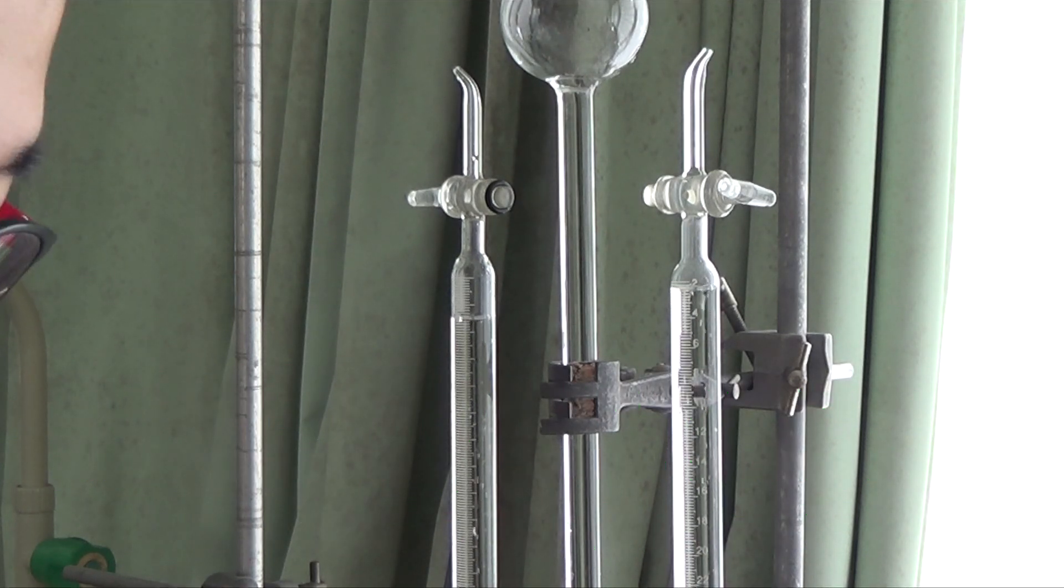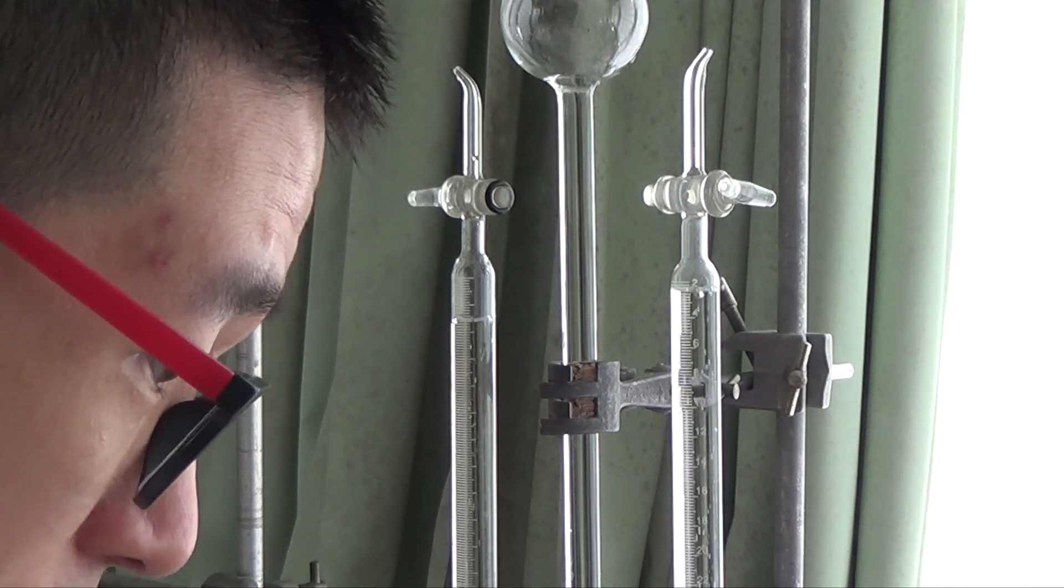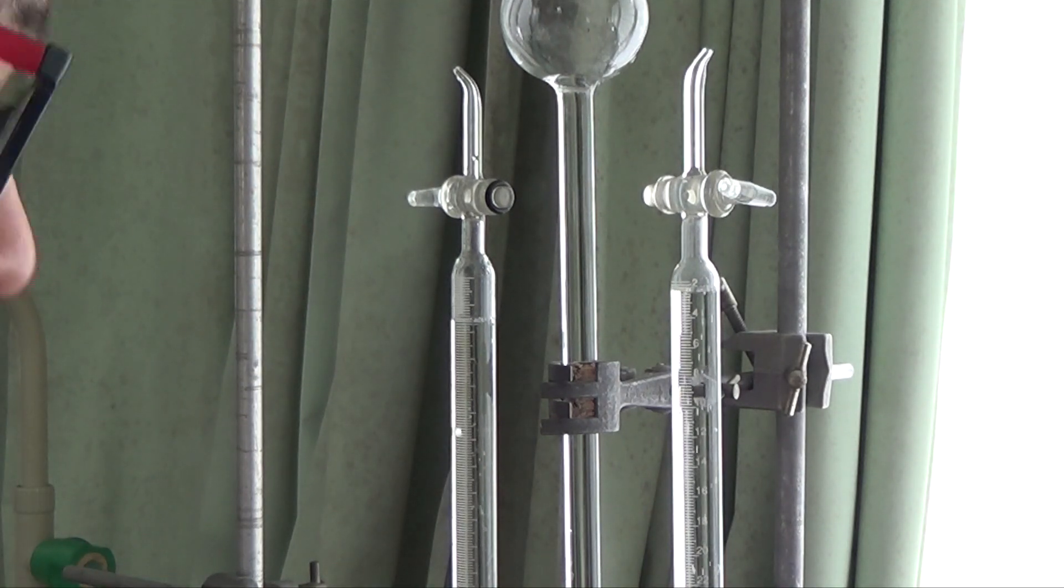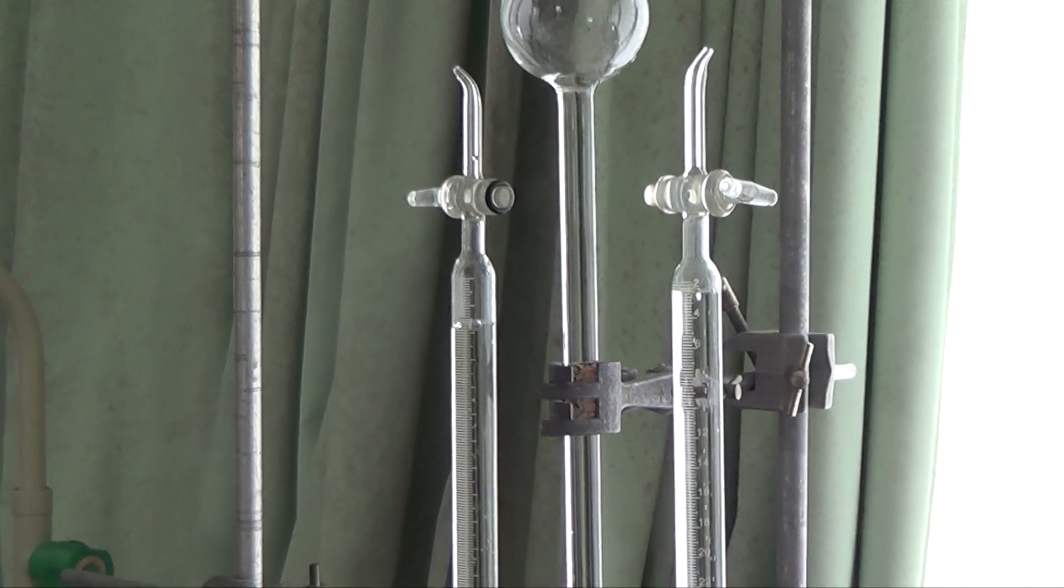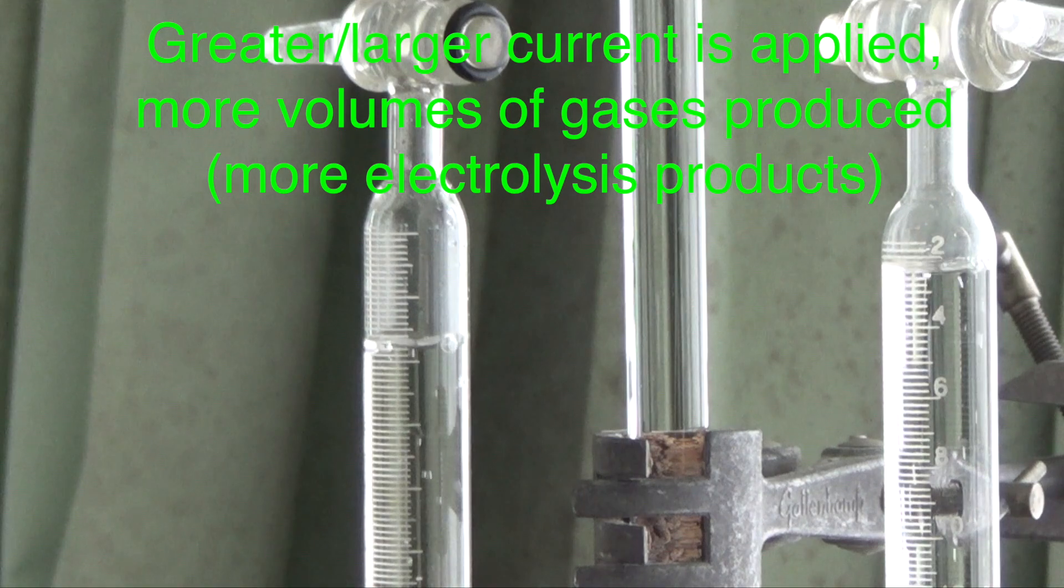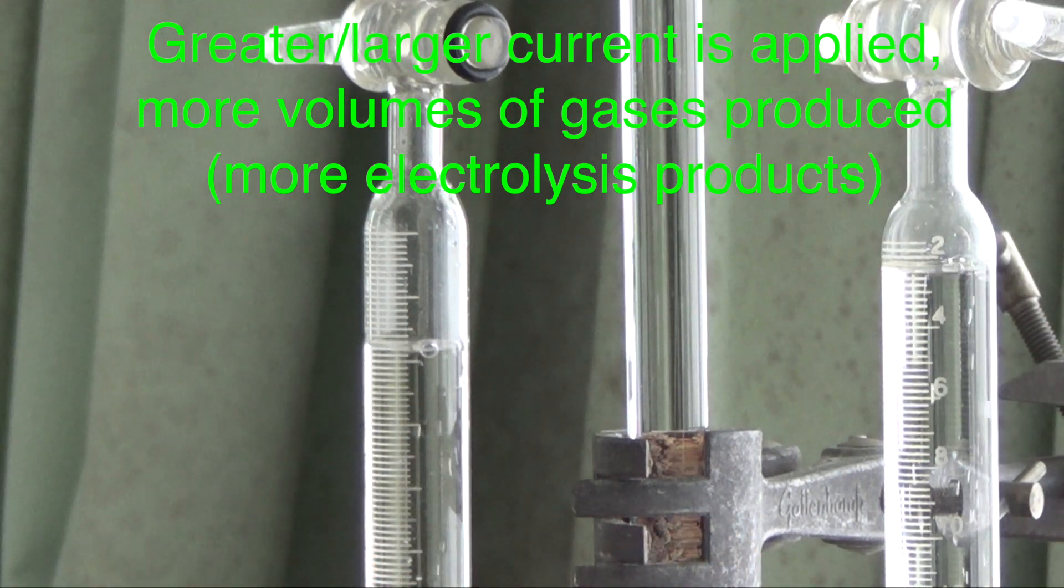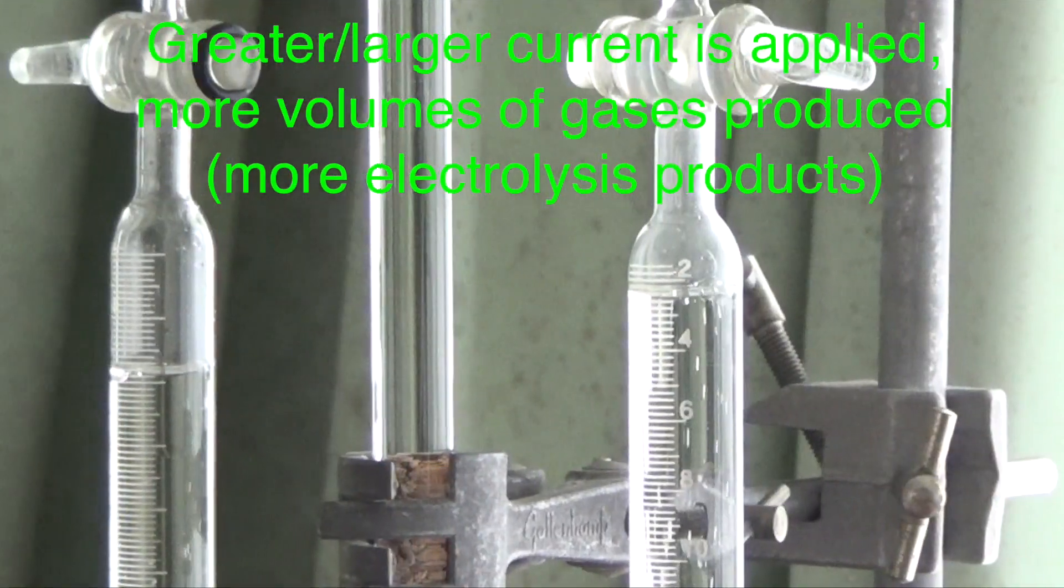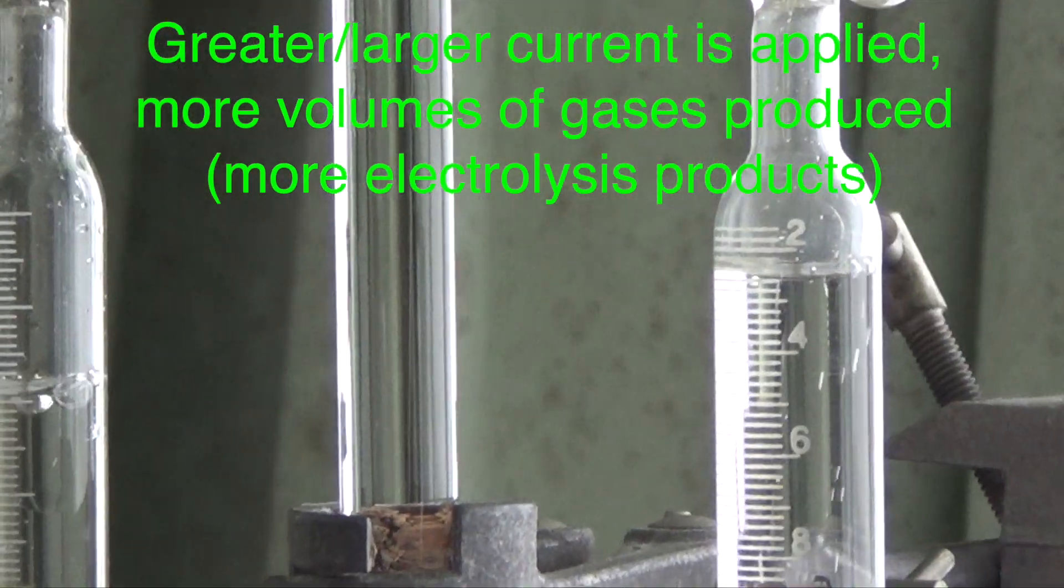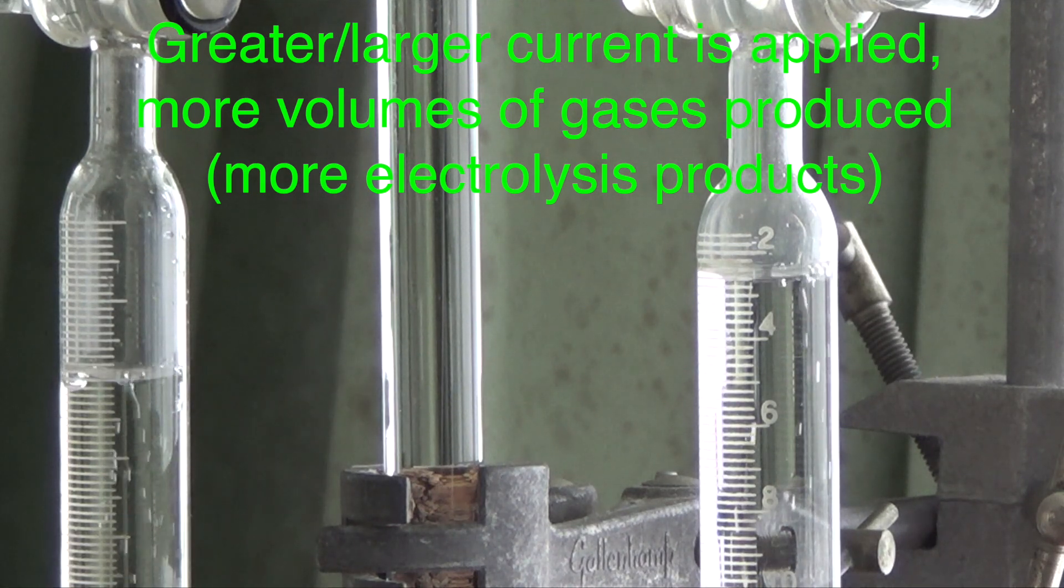What I'm going to do now is I'm going to increase the current. Oh, this is cranked up to the max already. I'm just going to decrease the current and hopefully you can see what's going on. So just now this was maximum. I'll go from the maximum current, so look at how rapid the bubbling is. I am just going to decrease the current a little bit.